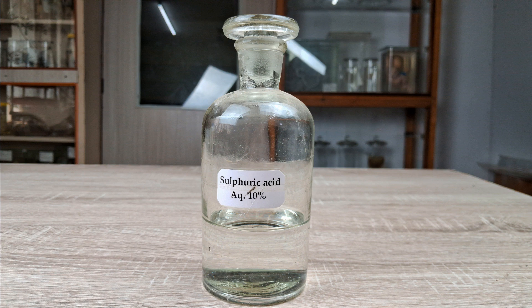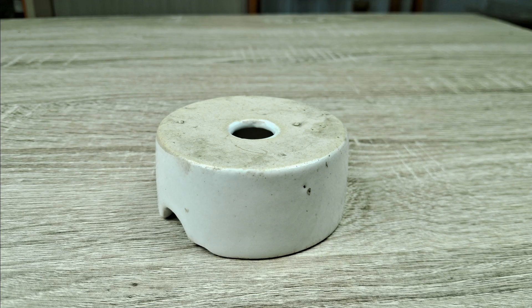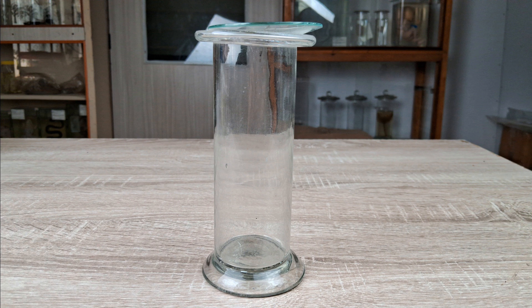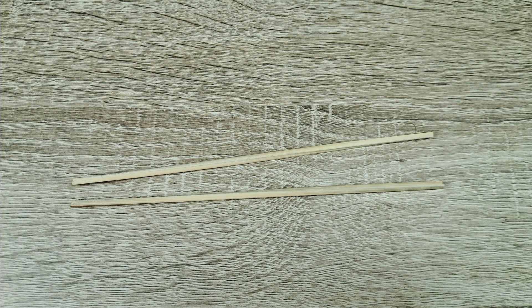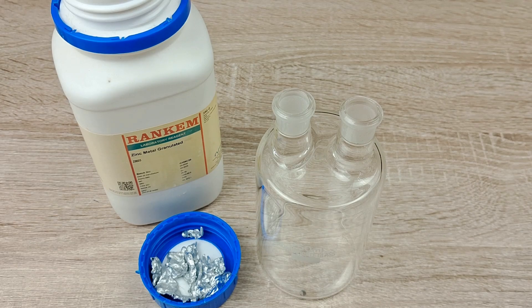Additional materials: a trough or a large beaker, a beehive shelf, a gas jar or a large test tube, a few wooden splints, and a matchbox. You can also use a candle.